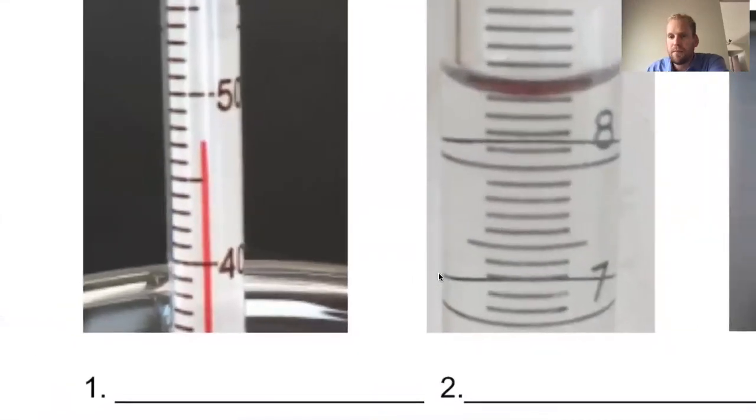What about the thermometer here? What's the value of the graduate? Now be careful here. We have 40 here and 50 listed, but the value of the graduate is the value of the marks on the tool. So even though it's not written, I know that this mark here is 41. This mark here is 42, 43, 44, 45, 46, 47, 48, 49, 50. In other words, the graduate has a value to the ones place. So we ask ourselves, what two graduates does it fall between? Well, it seems to fall between 47 and 48. So with all reliability, we can say that this is going to fall between 47 and 48 degrees.